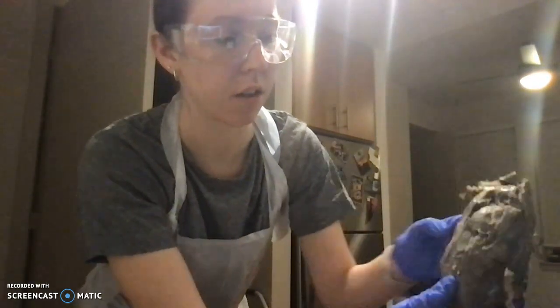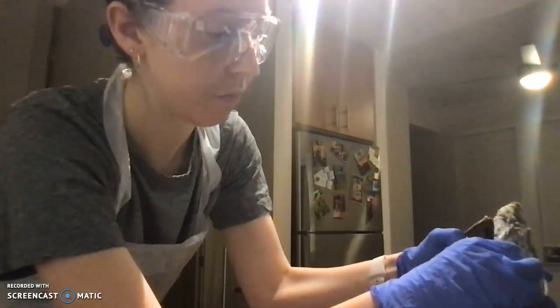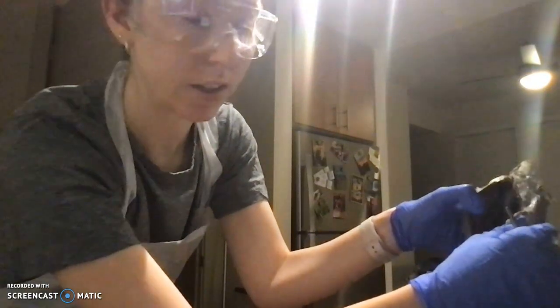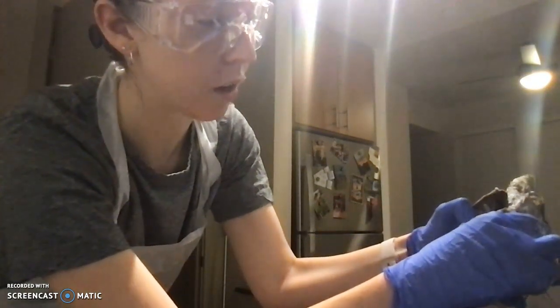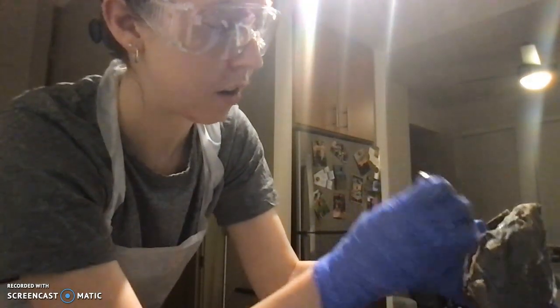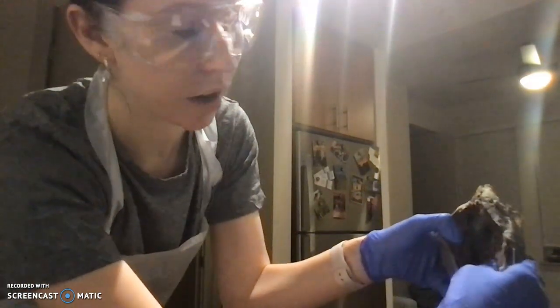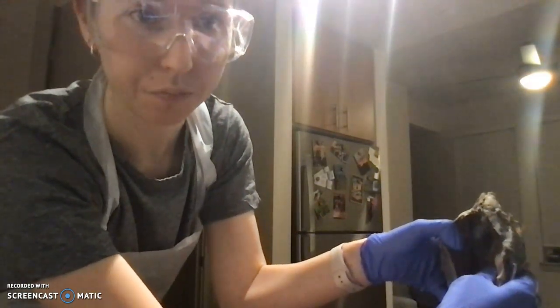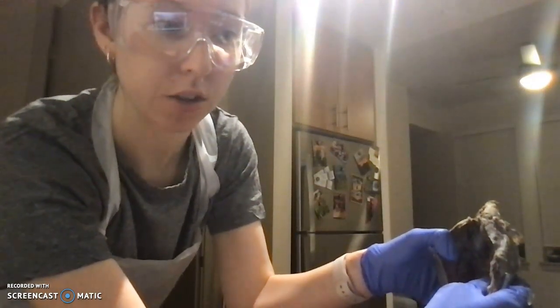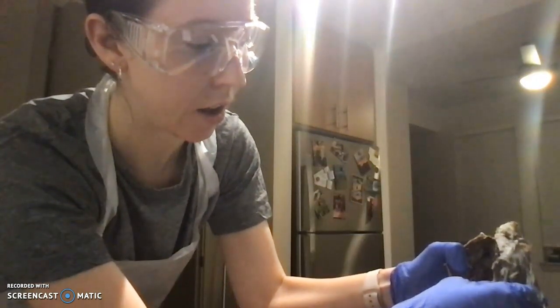Looking in on the left side of the heart here, if we were to open this up, the bottom chamber, you can really not see that. The bottom chamber is the ventricle, the top chamber is the atria. If we take a closer look here, you can see that there are little strands coming in here, and those are called the chordae tendineae. They are what attach to the mitral valve, which is what separates the atria and the ventricle.